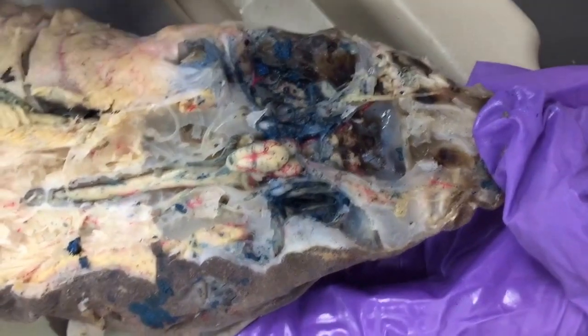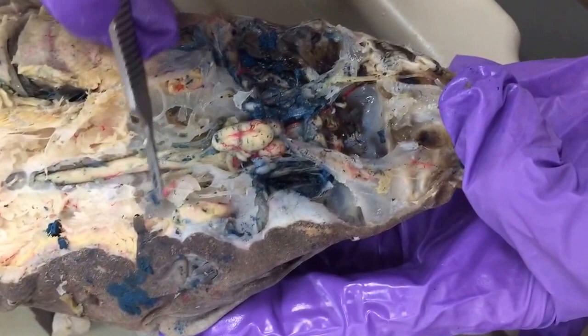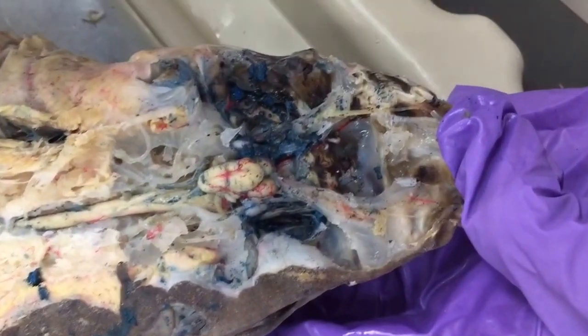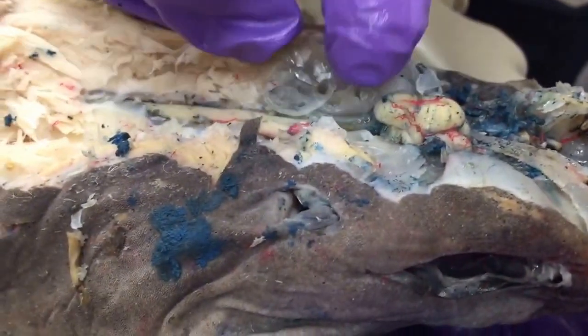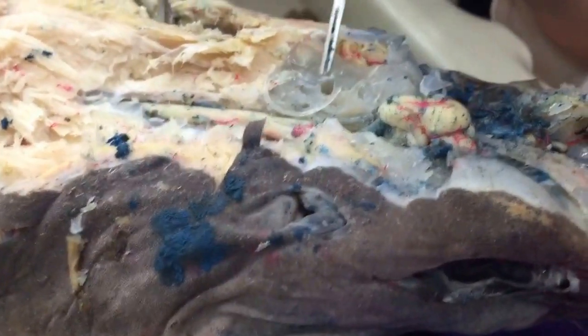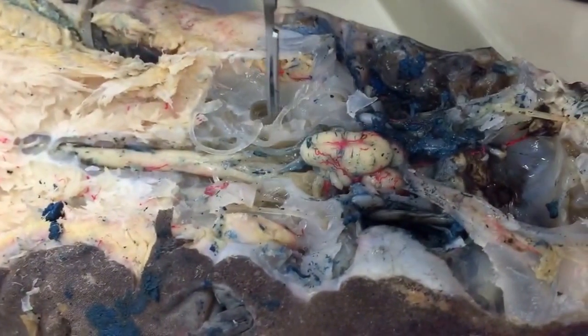Okay, the last section we're going to include on the exam is the structures of the inner ear, the semicircular canals, and the sacculus. So, oops, why is it so sticky? There we go. Okay, so this is the position of the sacculus. It's kind of this jelly-filled cavity on either side of the medulla oblongata here.